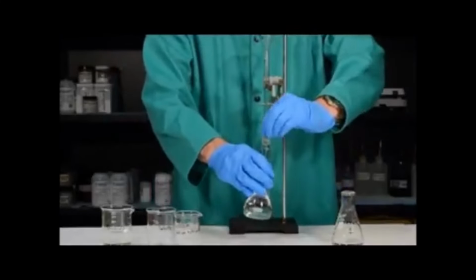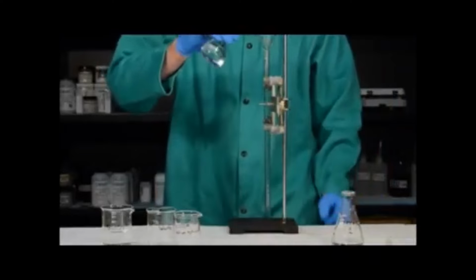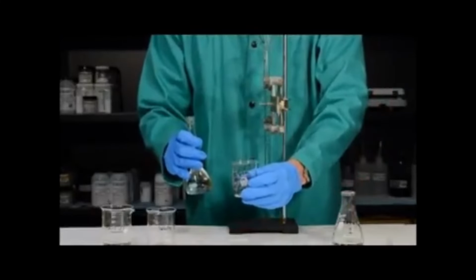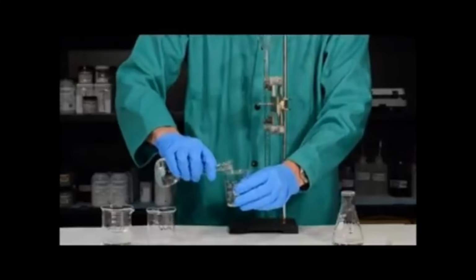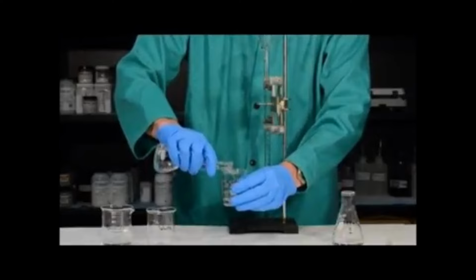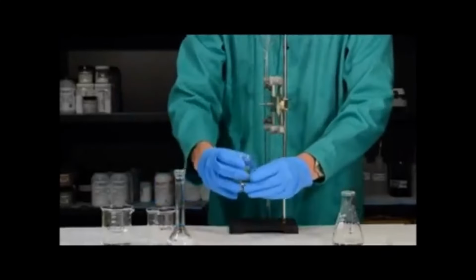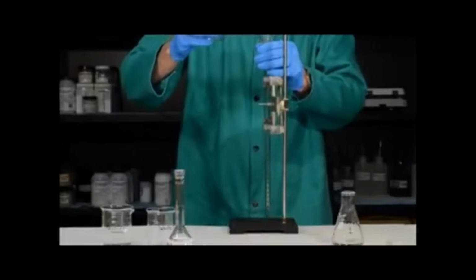It is a bad idea, bad practice, to pour from a volumetric flask directly into your burette. It is a much better idea to get a clean and labeled beaker. It is essential that this beaker is dry so that we don't dilute the sodium hydroxide solution. We simply add some of our sodium hydroxide into our clean, labeled, and dry beaker and use that to rinse the burette with 2 to 3 milliliter portions.